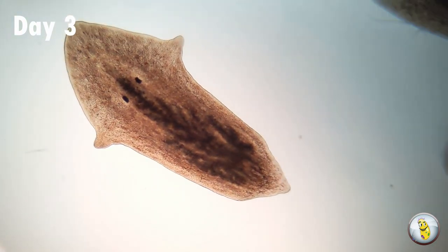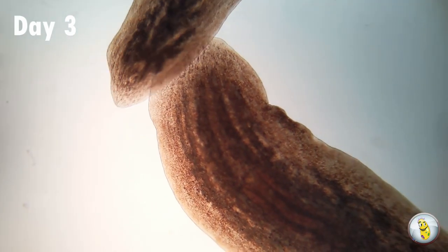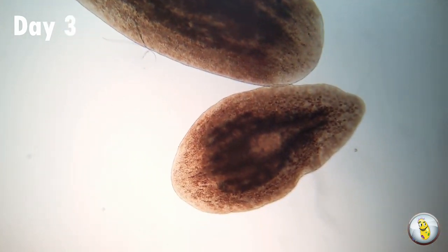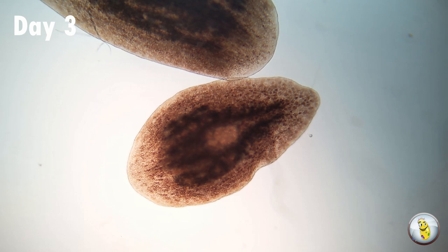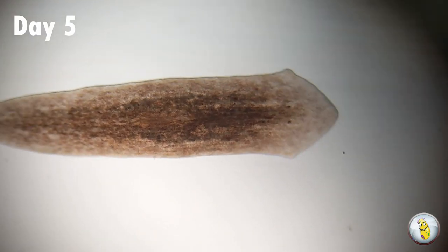The head has completely become active. It's swimming around and doing its normal planarian thing. I decided I would call this experiment complete when all three parts had a well-defined head, eyes, and tail.